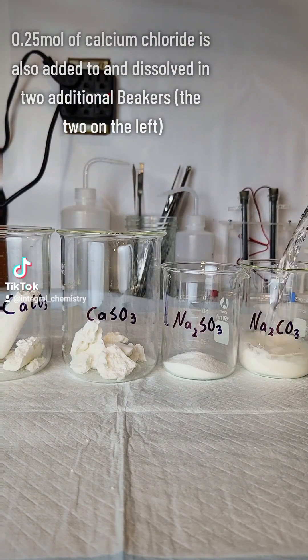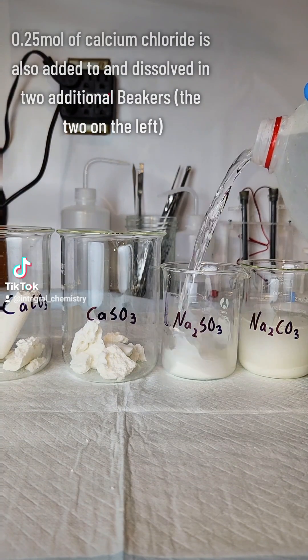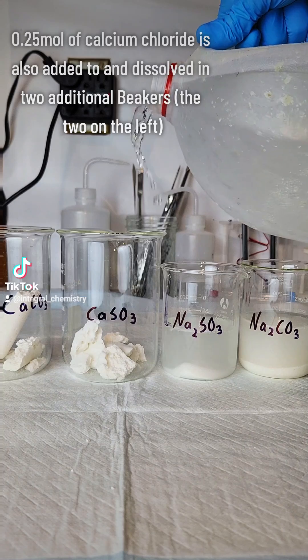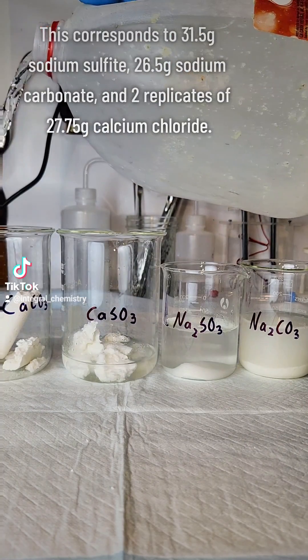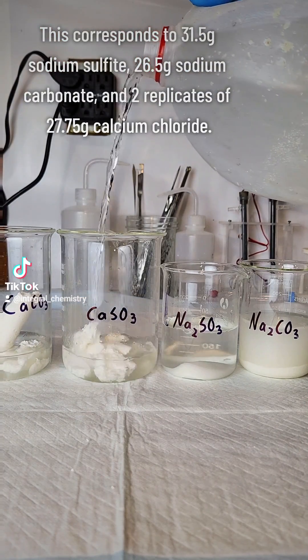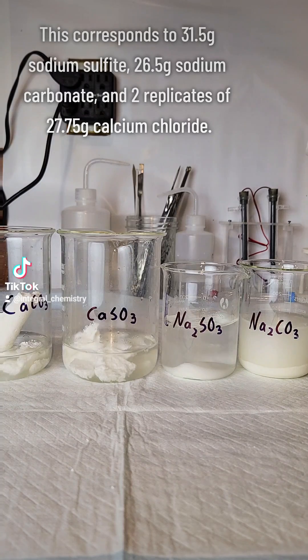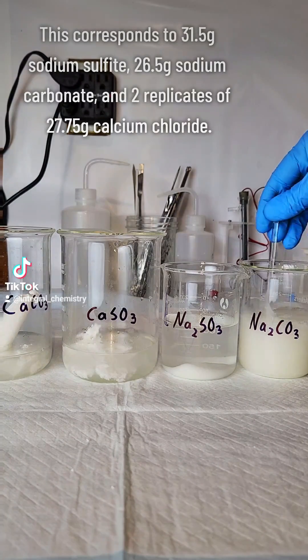To get started, I dissolve a quarter mole of sodium sulfite and a quarter mole of sodium carbonate in two different beakers. In each of the two beakers on the left, I dissolve a quarter mole of calcium chloride. If you're more familiar with grams than moles, I've included those on the top as well.